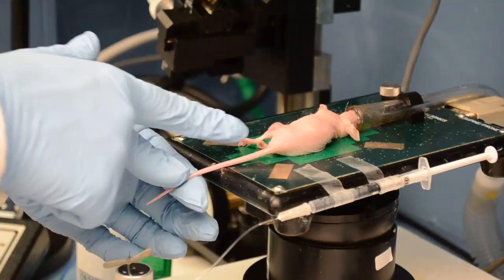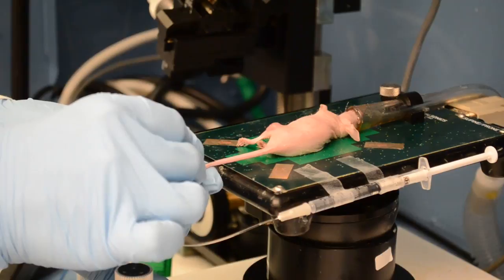Grab the tail towards the tip and gently but firmly place the 27 gauge needle of the cannula into the vein.